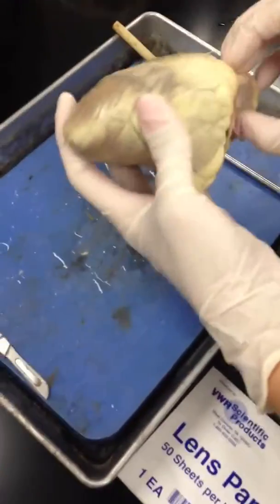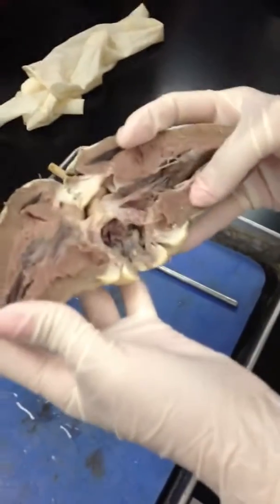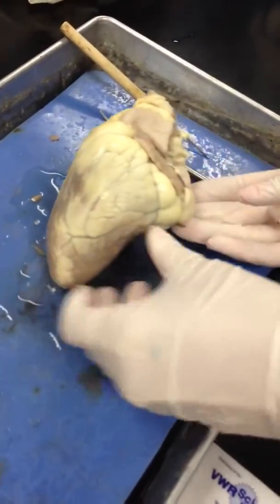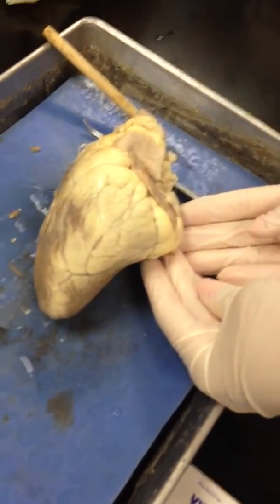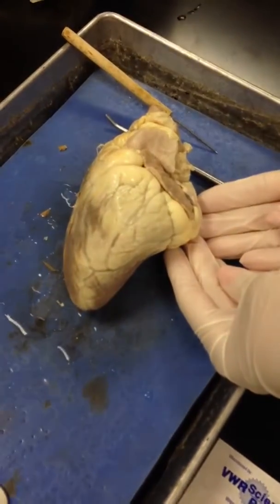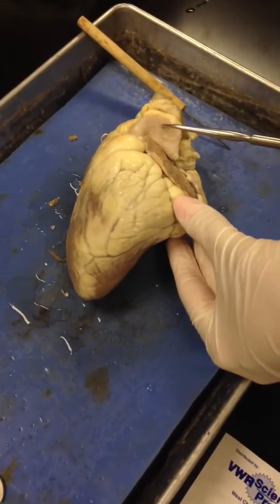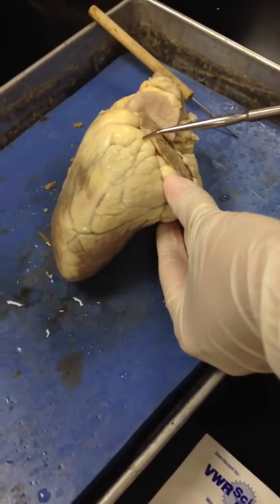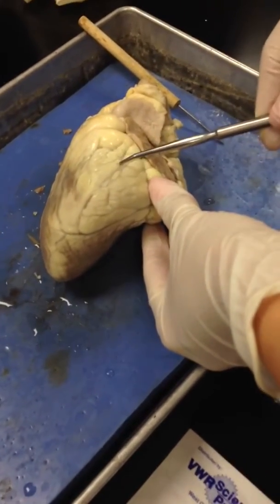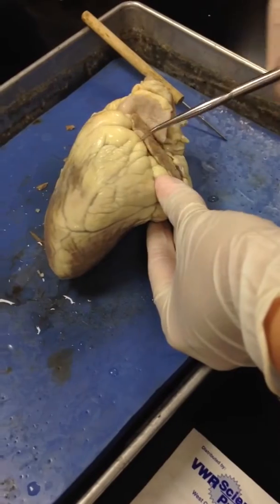I think this is a pretty good heart. You guys saw the different structures and everything? Okay, first let's start off with: what side of the heart is this? Anterior. Anterior, because we see the pulmonary trunk right there swooping towards the left. And we also kind of see the anterior interventricular sulcus separating the ventricles.